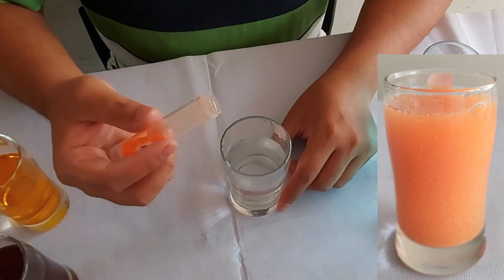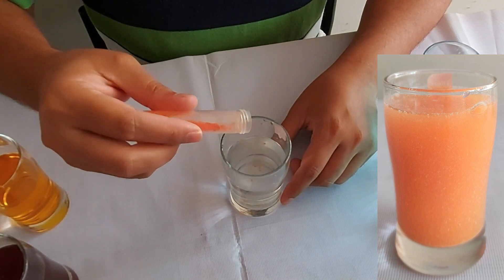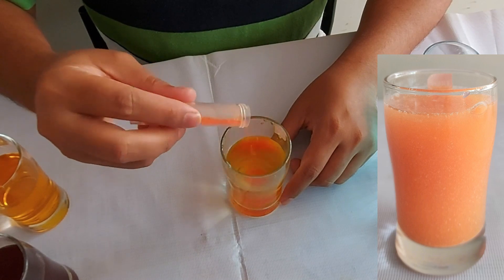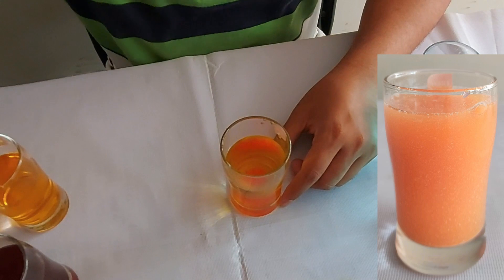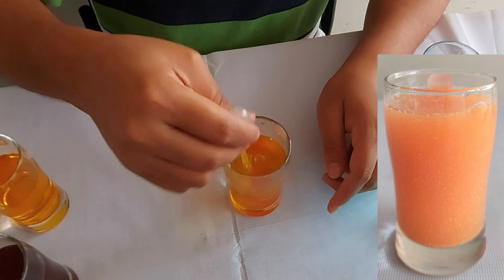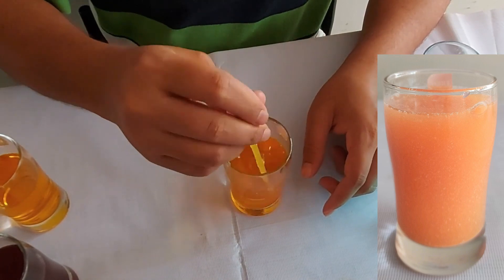For the orange color, we are adding potassium dichromate to the water. Let's see what is happening. We have added it and now we will mix. See, a very nice orange color is coming from the potassium dichromate solution.